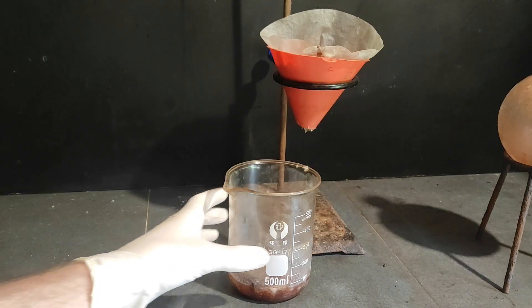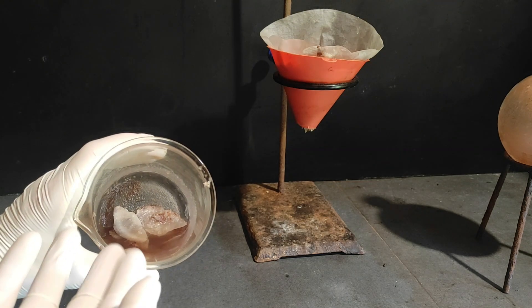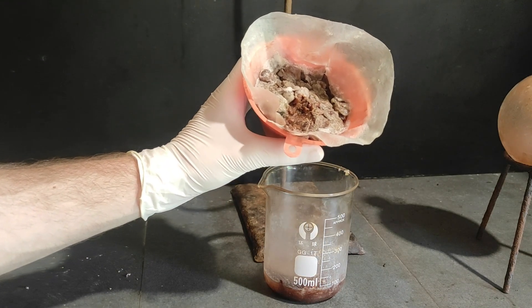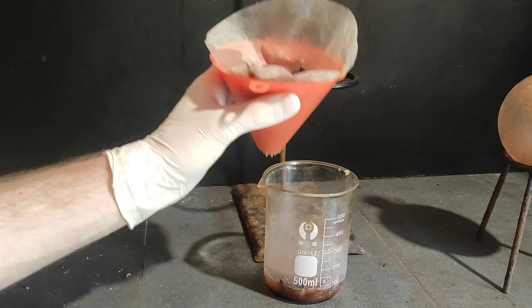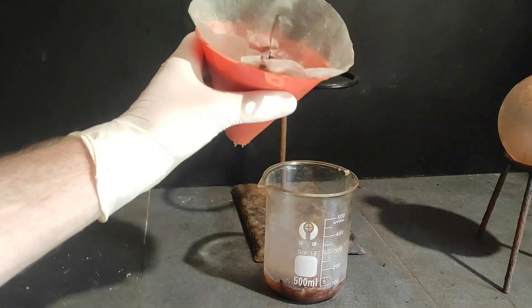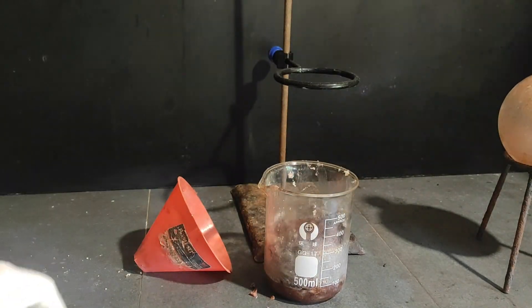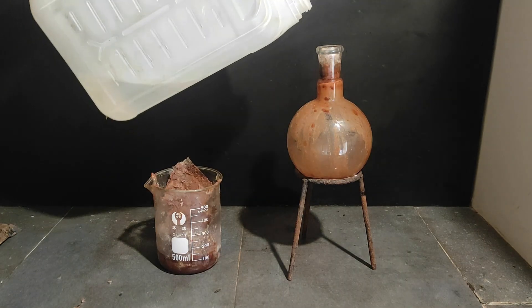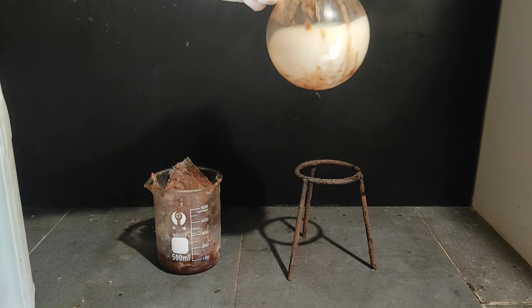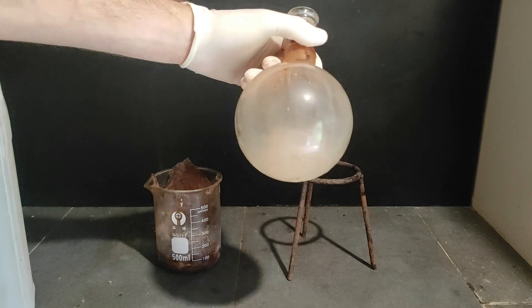The white stuff is probably our product, and there is also some contamination — toluene, etc. So what I think I'm going to do is dissolve all of this in water, and what doesn't dissolve is not the product. This way, hopefully we can purify by recrystallization. I'm going to wash the round-bottom flask quickly with some water. Most of it should dissolve because it is the product. When I shake the flask with some water, the supposed product dissolves very fast, which is a good sign, because real tar is not soluble in water at all, and para-toluene sulfonic acid is very soluble. So that's good.